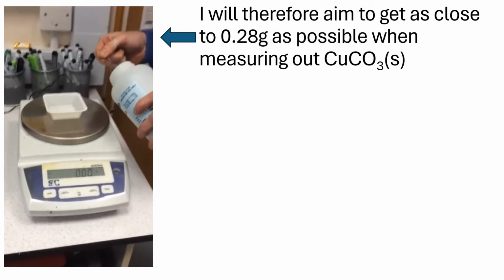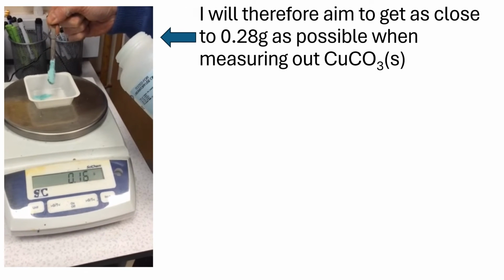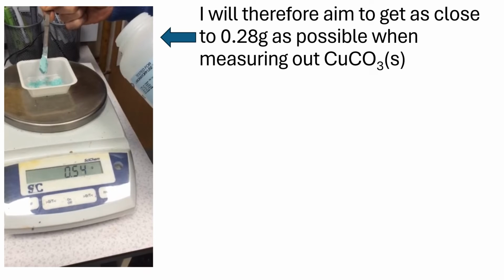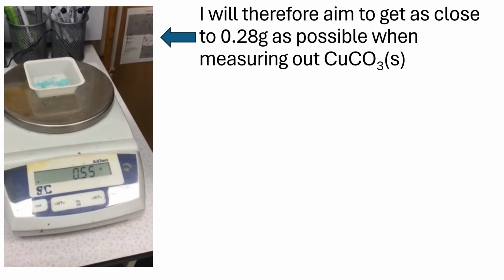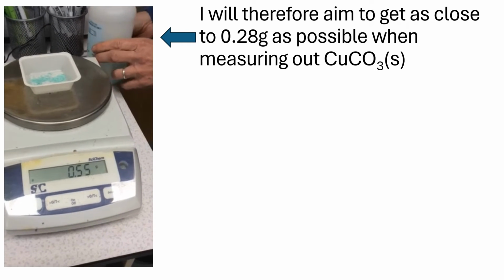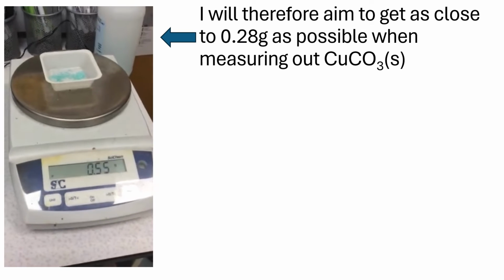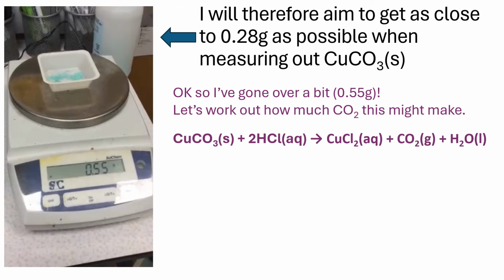So what we're going to do is just demonstrate weighing out the copper carbonate. I'm going to try to get as close to 0.28 grams as possible. So you can see obviously it's gone to 0.55 already. So it's a bit more than I wanted, but let's have a look and see how much CO2 this might make. So I'm trying to calculate in theory how much carbon dioxide I get from 0.55 grams of copper carbonate.